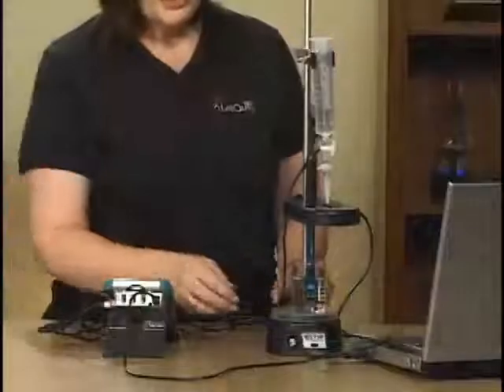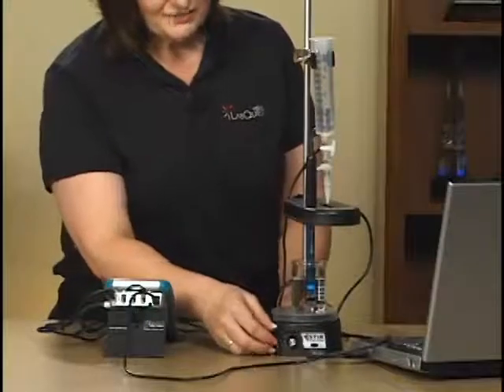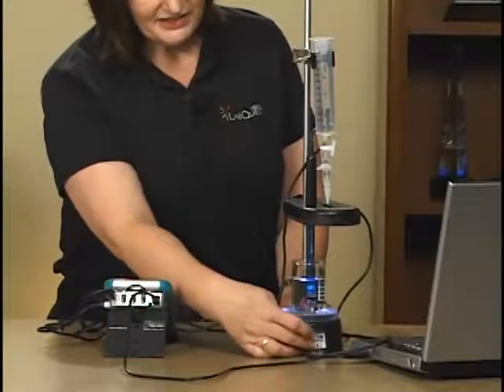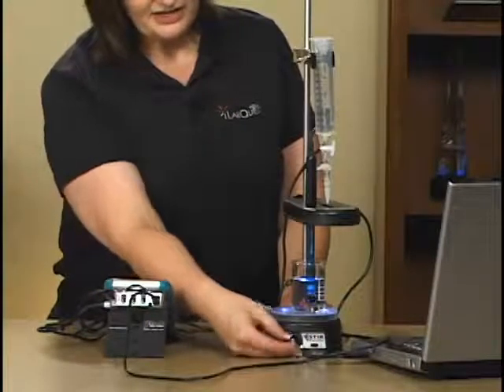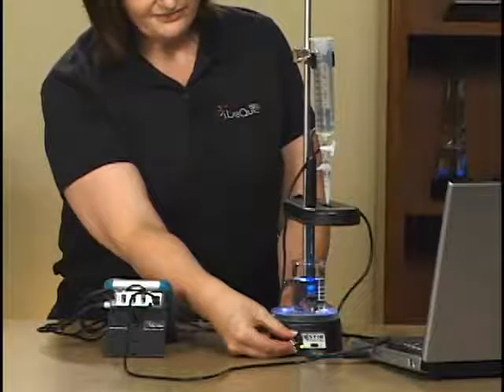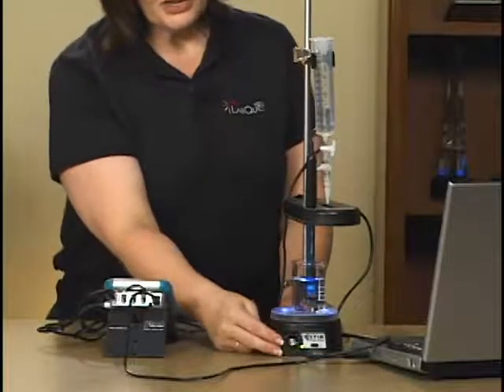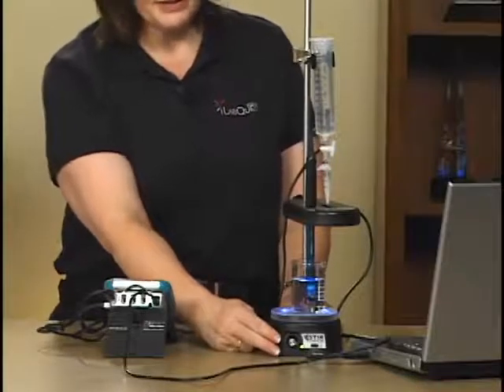I'm going to show you some of the equipment that you're going to use to do this lab. We'll start with a stir station. This is our magnetic stirrer and it has some LEDs. I'll turn on here and then turn on the stirrer itself. This stir station has a built-in ring stand. It can also be run on batteries or through AC power.